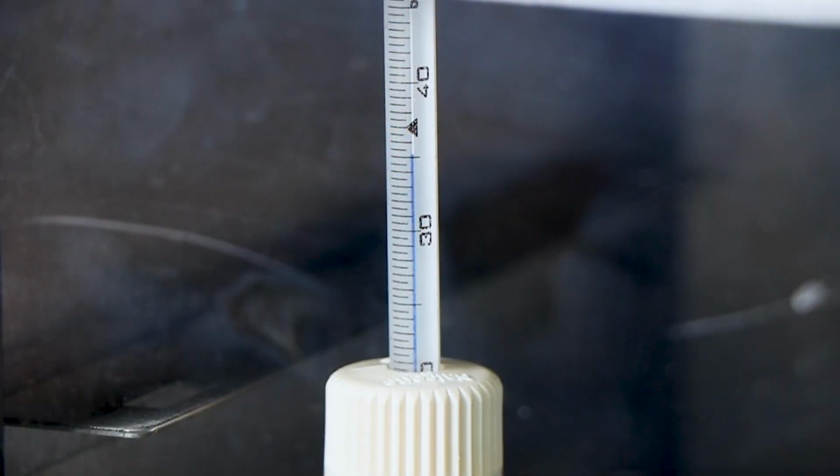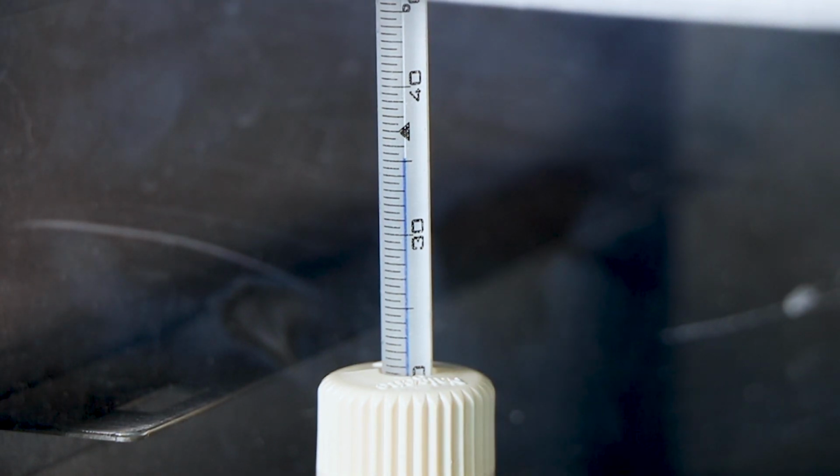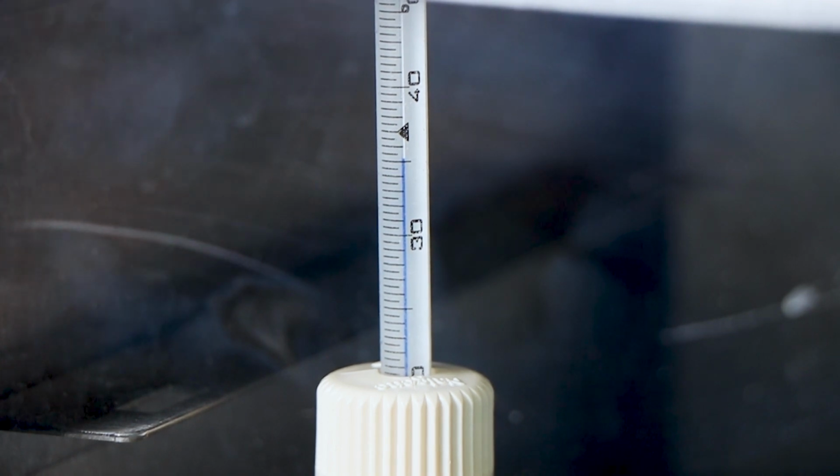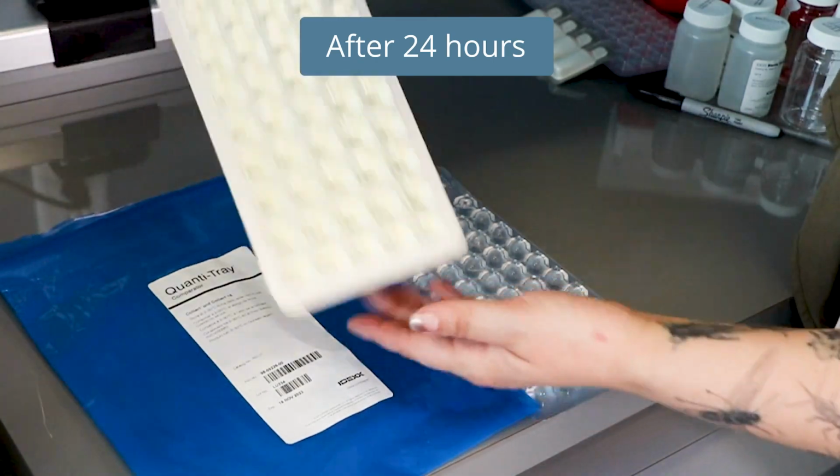Be sure to check that the alcohol thermometer inside the incubator is at 35 degrees Celsius. The digital display is not always accurate and should be compared to the alcohol thermometer regularly. After 24 hours, compare each incubated sample against the color comparator.